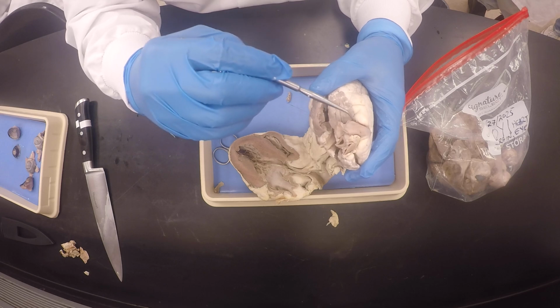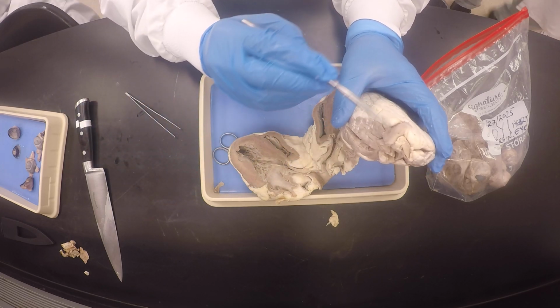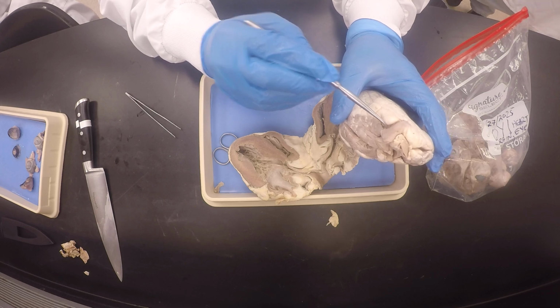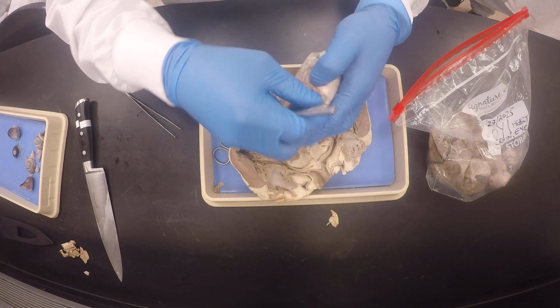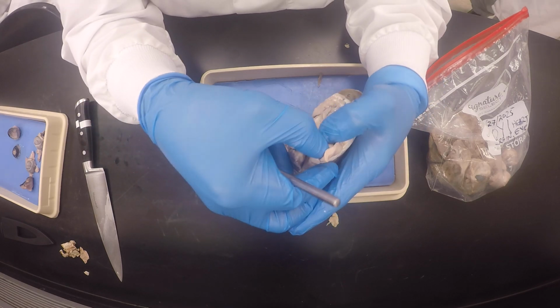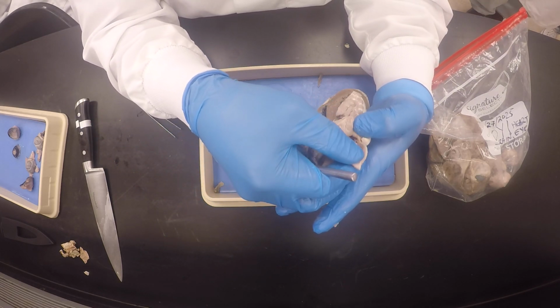I cut it through here. Do you see? I had to cut it so that we could see it, but I made the cut so you could still see it is intact. So it's not looking all flappity-flap. Okay? So here, my good friends, do you see it? Do you see the pulmonary semilunar valve?